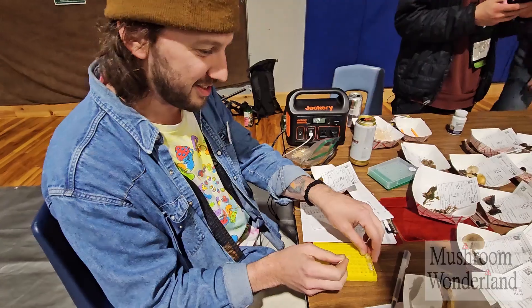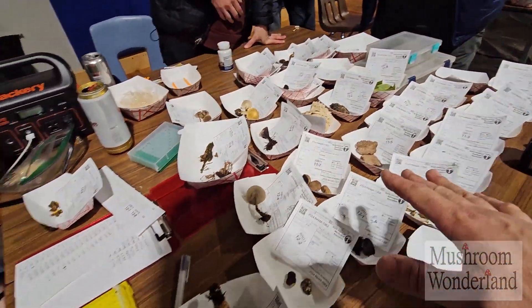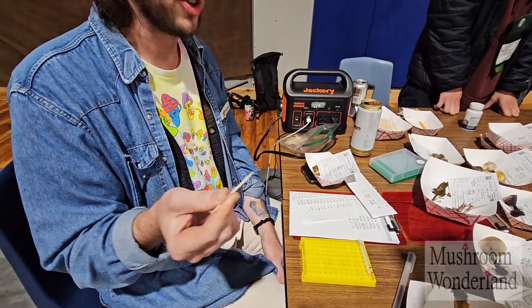This is Matthew Koons, here working on all of these vouchered specimens. He's sampling all these fungi for Hart's nanopore pipeline, finishing the last of six plates — that's six times 96 samples. They should have data for all of them by end of tomorrow when Hart gets back to California. He's running the nanopore while driving back to California.